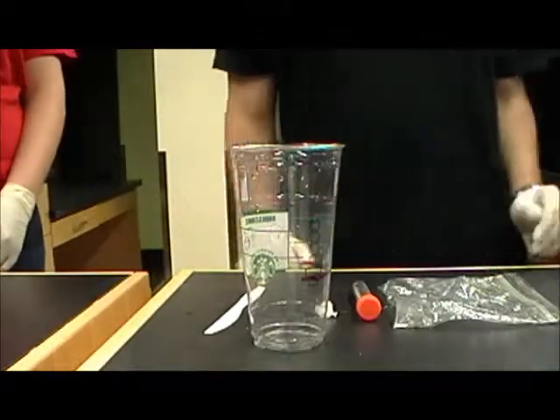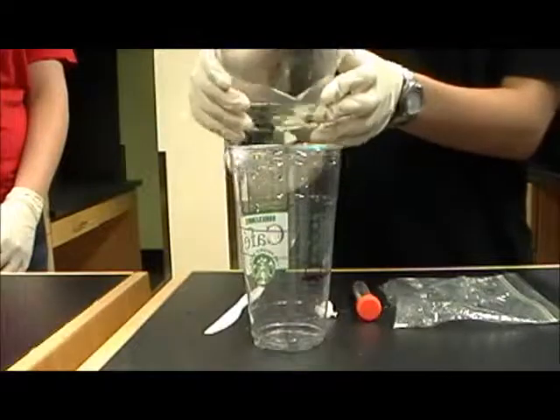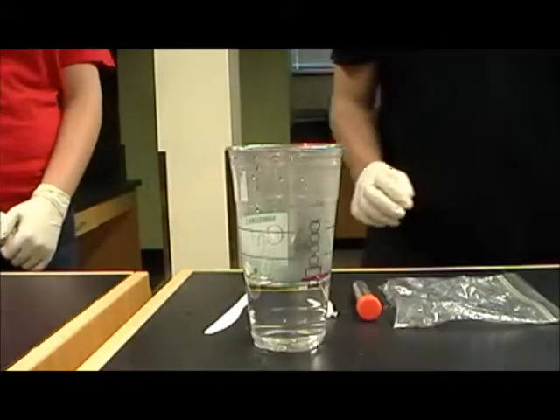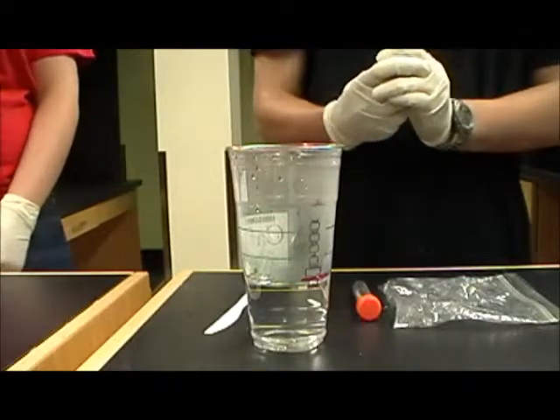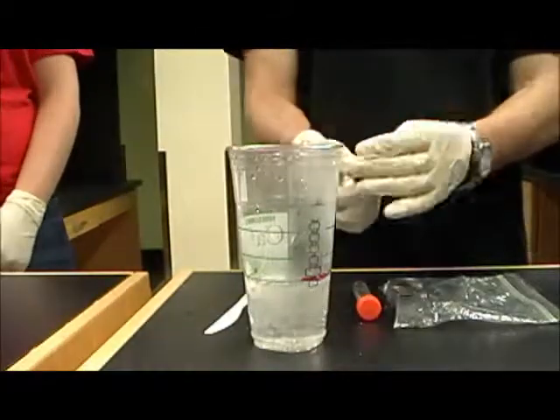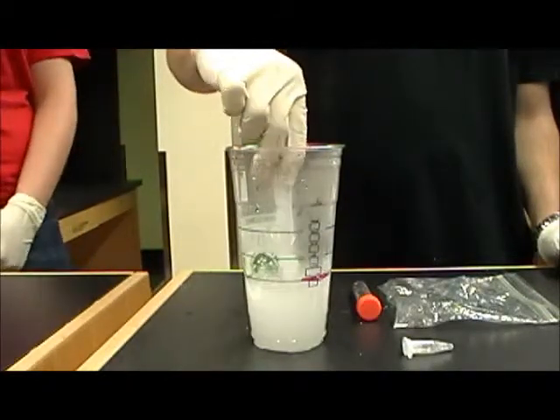So then for this part of the experiment, first have one student from each group come up to you and place some steaming hot water in their cup. You can fill the cup up to the marked line that we'll have. Then have the students carefully carry that back to their workstation. And they each should have a tube of starch. Have them pour that tube of starch into their provided hot water cup. And then mix it up so that the solution turns cloudy, much like you did in the demo for them just a few minutes prior.